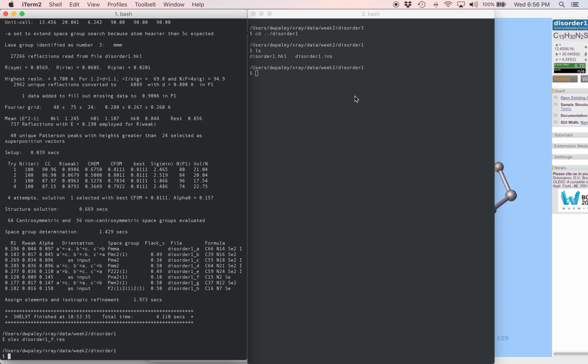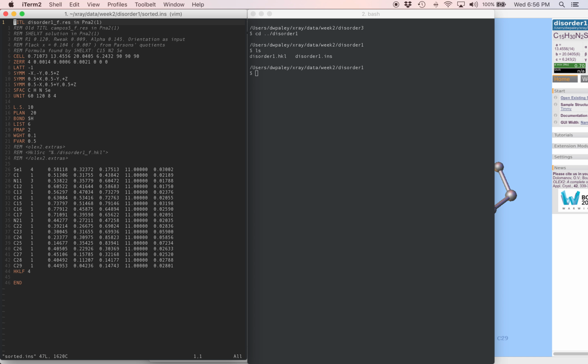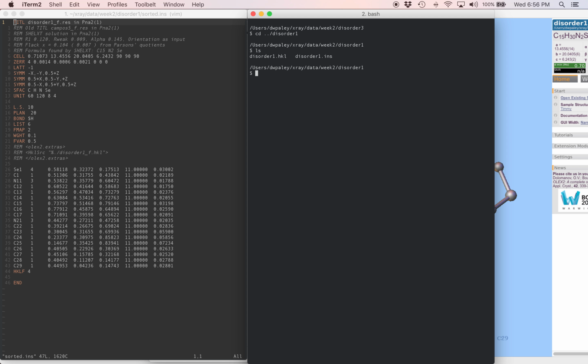I'm going to come back to my terminal. I like to have 2 terminal windows side by side because then I can look at my SHELXL code in Vim and I can run refinements in the other window at the same time. So let's open sorted.ins in the left window. This all looks pretty familiar, and we can see that the atoms are in order, so that's good. And on the right, we can try running SHELXL. We'll see what happens. SHELXL sorted.